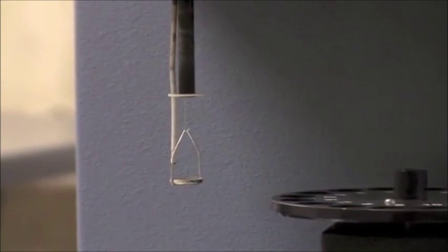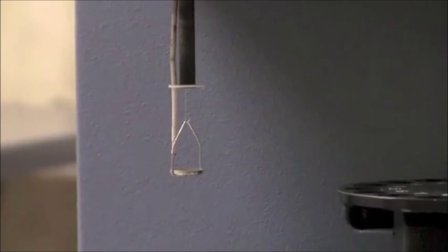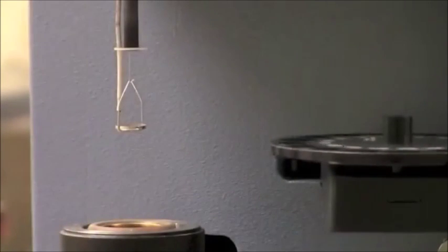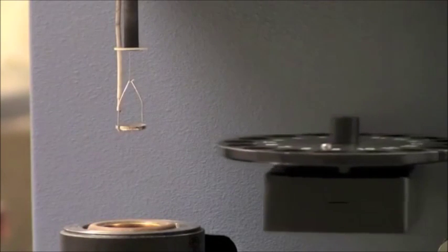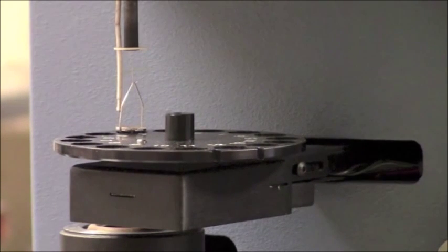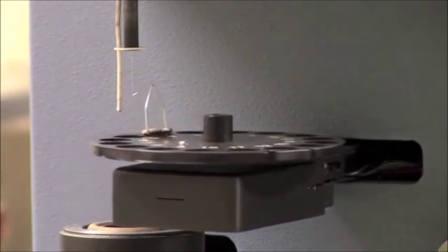And so what's going on is the pan's getting weighed, and it's going to close the chamber here. We're going to fast forward because it takes a little while, and once it's done, it will place the pan back in the selected slot that you've chosen. And we're ready to put our sample in.